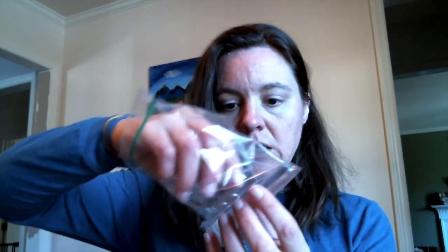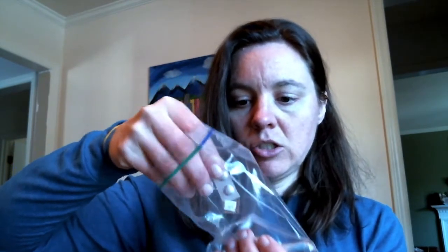Okay guys, so I have my little teeny tiny tube full of water for my dissolved oxygen test. So I'm going to find my dissolved oxygen tablets. They should be in this lovely bag, either in a separate baggie labeled dissolved oxygen tablets or DO tablets, or I stuck a little sticker on the back of the tablets that says DO.